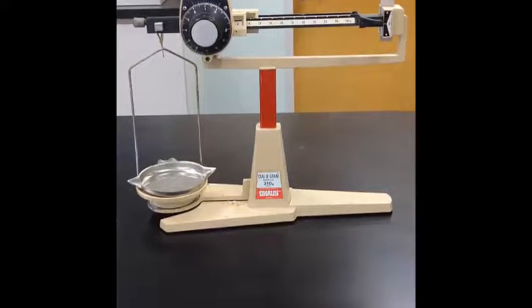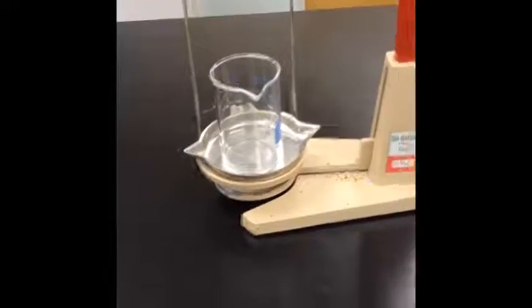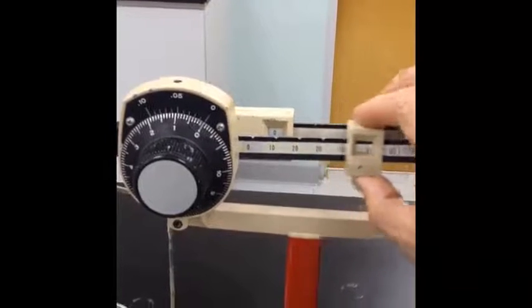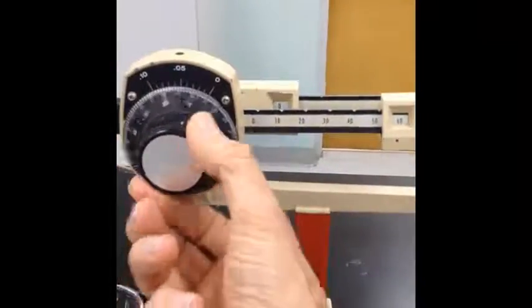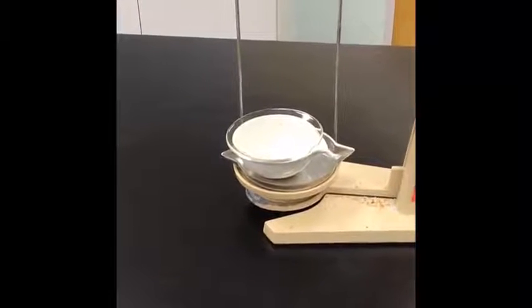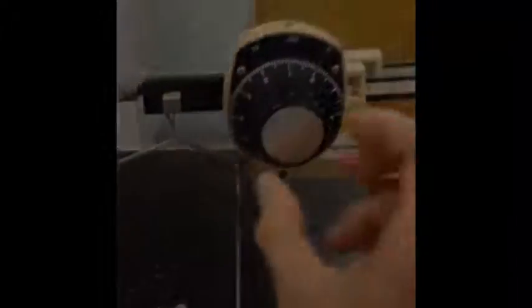As you begin the lab, the first thing we need to do is zero the balance, as you learned in class, to make sure that you have an accurate record of your mass. We will need to find the mass of an empty, dry beaker that we'll use to gather our mixture of salt and sand. And once we've found the mass of the beaker, we'll proceed to find the mass of the watch glass with an evaporating dish, and we will keep them together. We'll find the mass of them together, and then the mass of a single piece of filter paper.